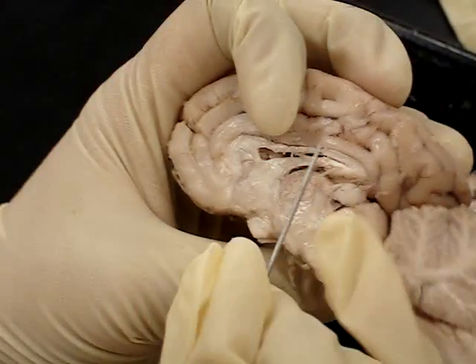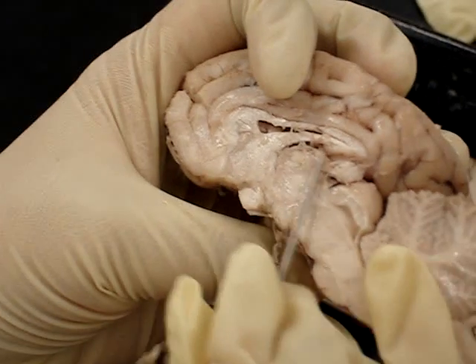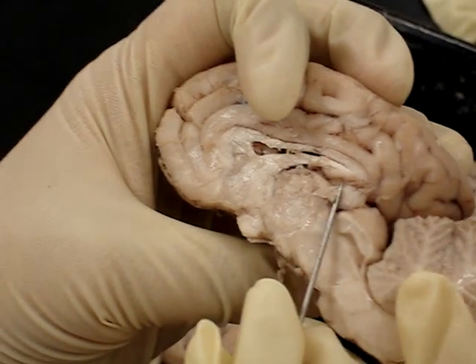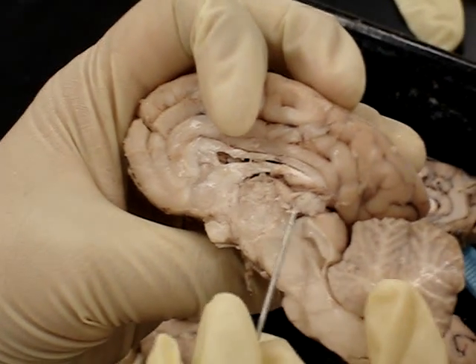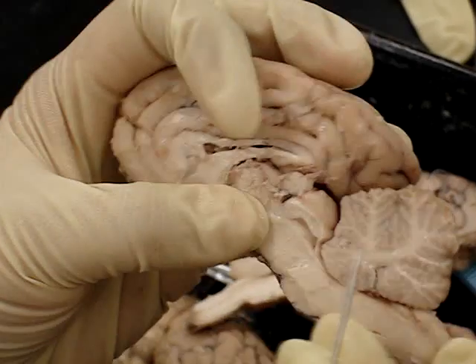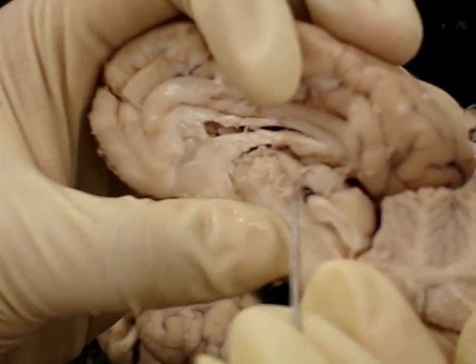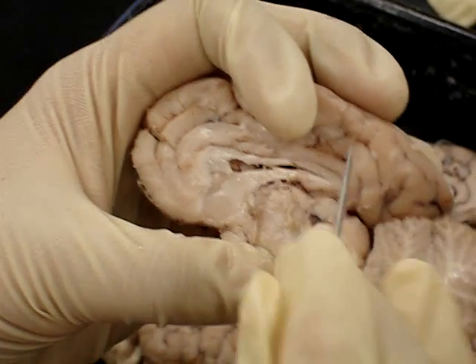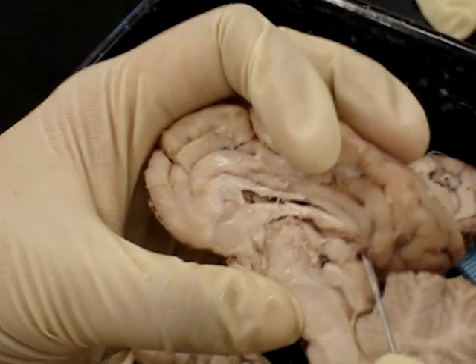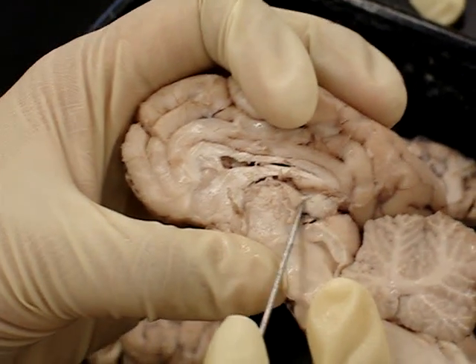The pineal gland is this. So there's the masa intermedia — look for the masa intermedia. Behind that, this little oblong shape, is the pineal gland. Somebody said that if you need a marker for it, it looks like a P. It's this area, this round structure.